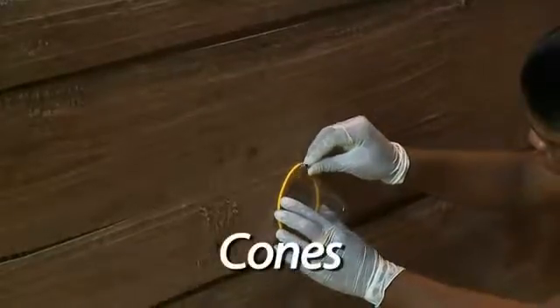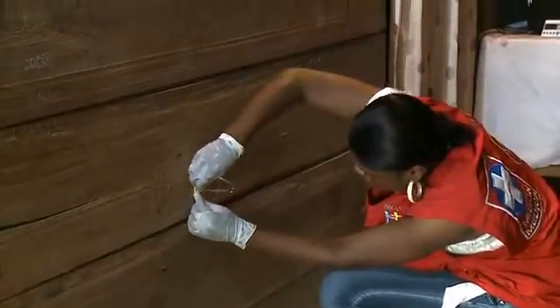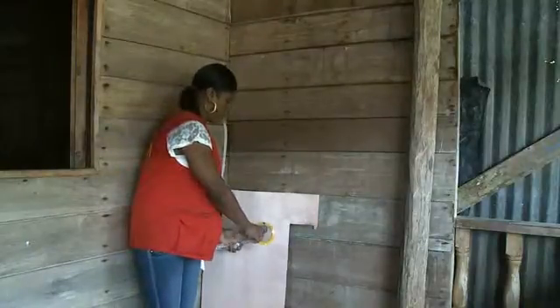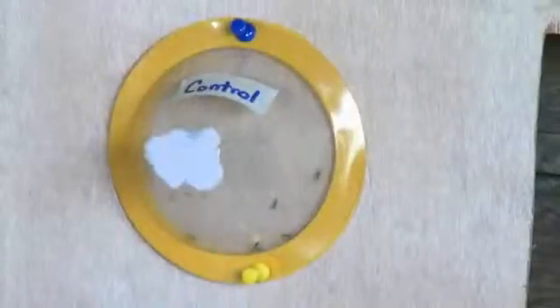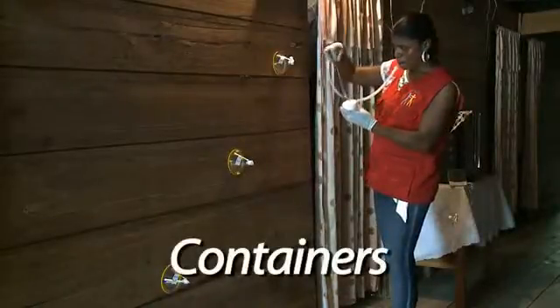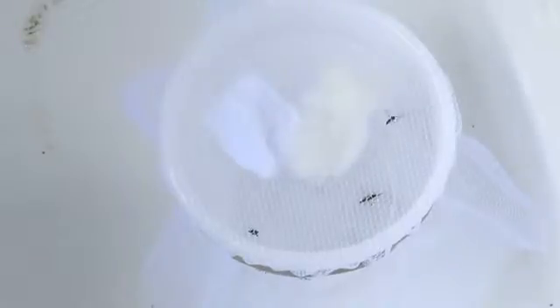Exposure cones are attached to the sprayed surface using tape or thumbtacks. Control cones are attached to insecticide-free surfaces. After the mosquitoes are exposed to the surface in the cones, they are transferred to covered containers.